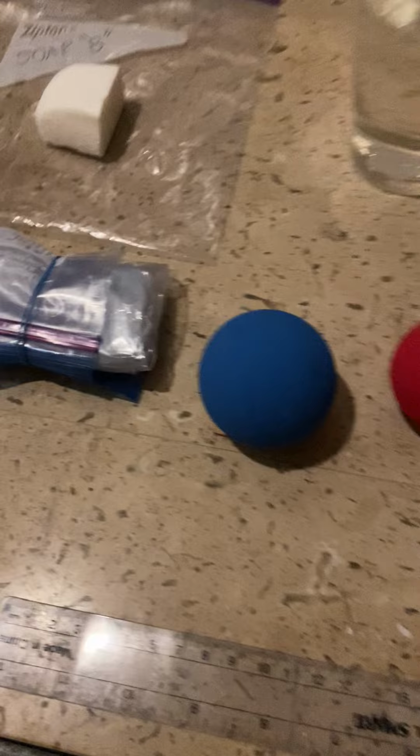Hi, my name is Ahmad, and today I'll be demonstrating Station Y 8th grade science experiment called Soaps and Water. The objective for today is to measure the density of two different soap bars by calculating the volume and the mass in grams, the volume in centimeters, using the three dimensions, height, width, and length. And then after that, I'm gonna predict whether it would float or sink, and then I will measure. How about we just check out the material?